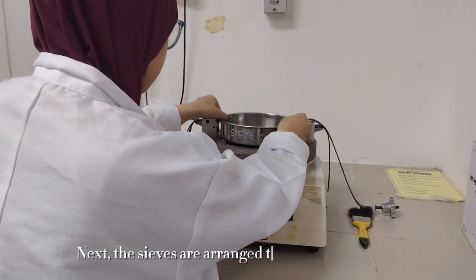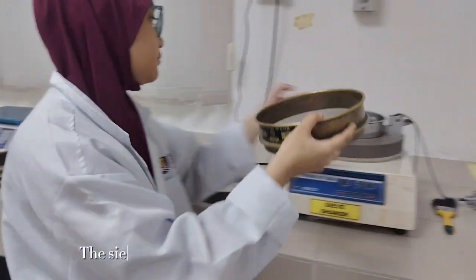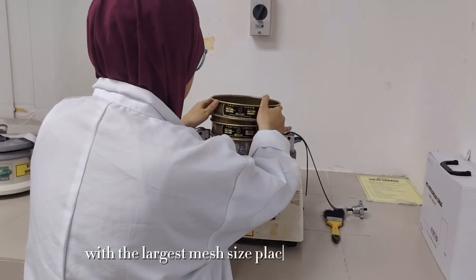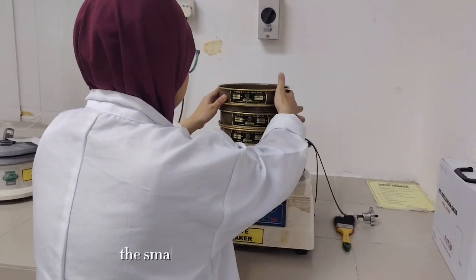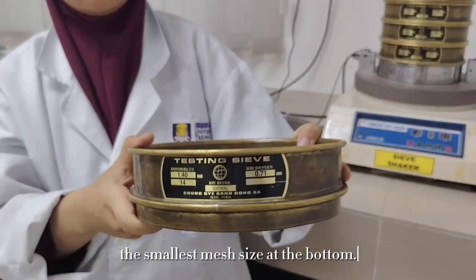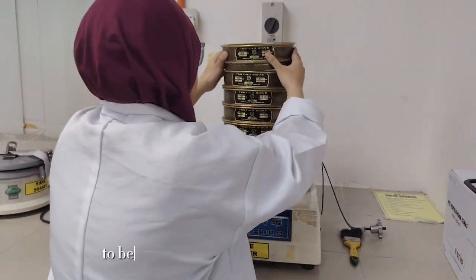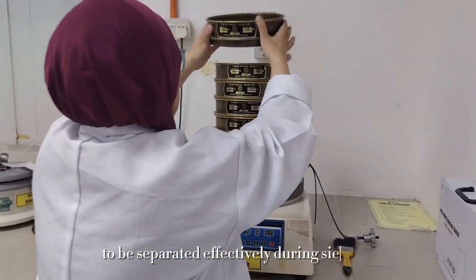Next, the sieves are arranged to form a sieve stack. The sieves are assembled according to mesh size, with the largest mesh size placed at the top and the smallest mesh size at the bottom. This arrangement allows particles of different size to be separated effectively during sieving.